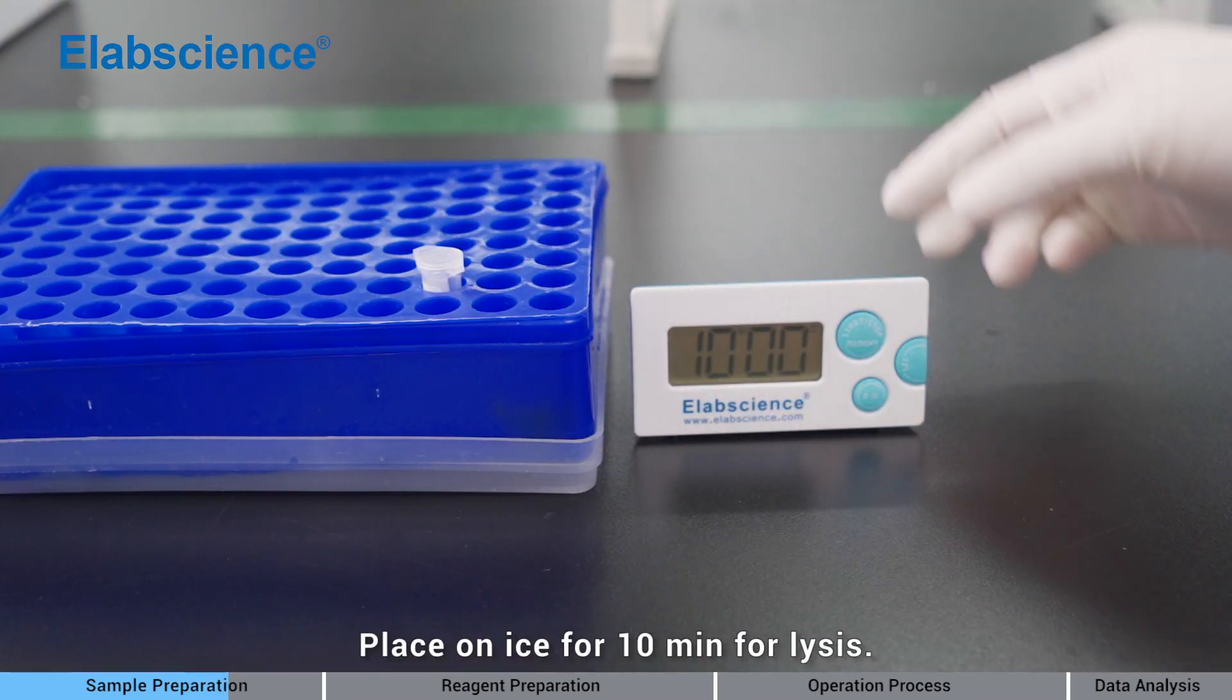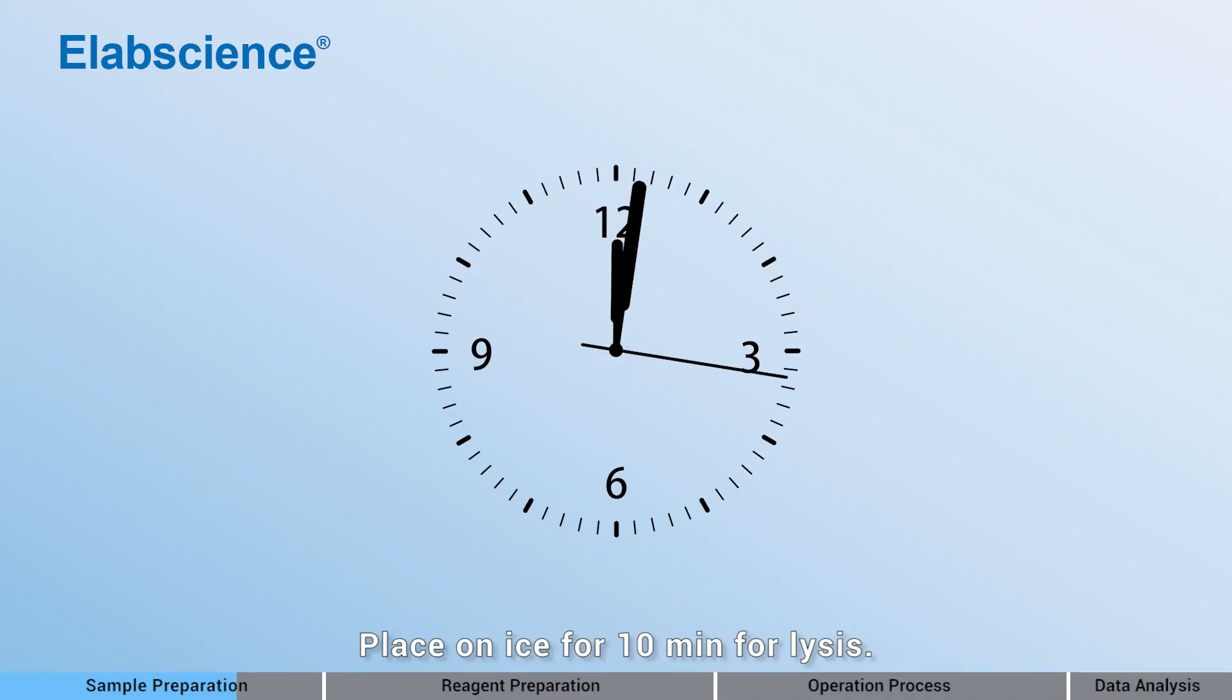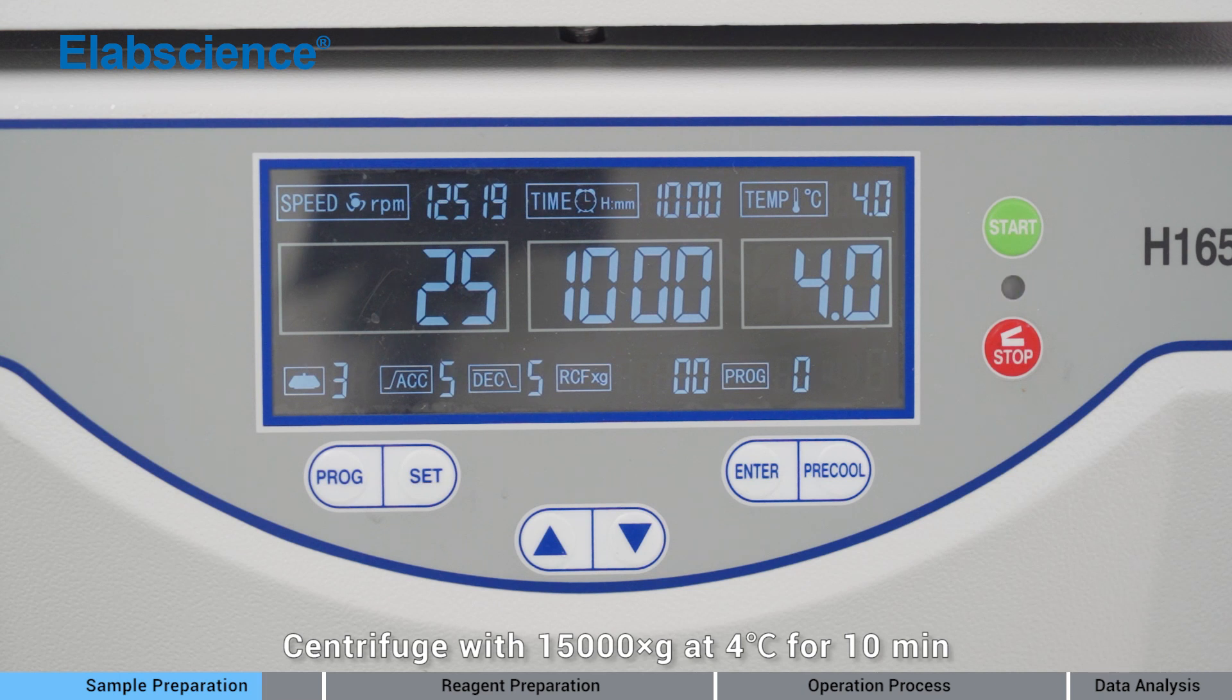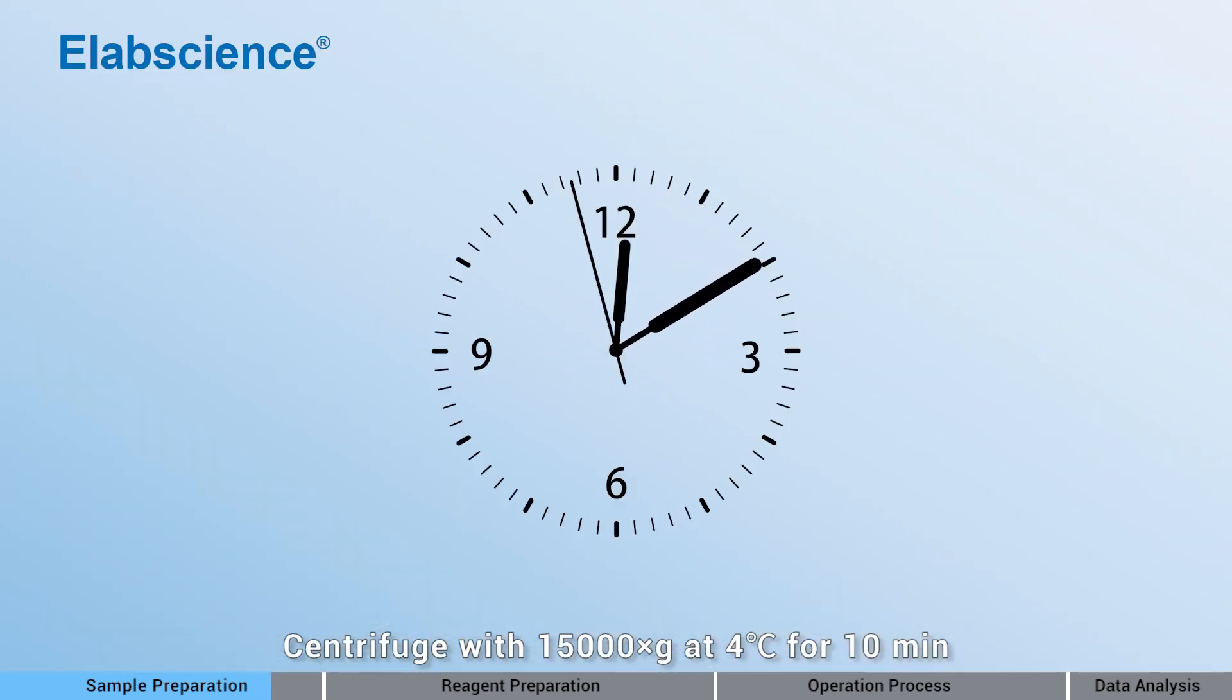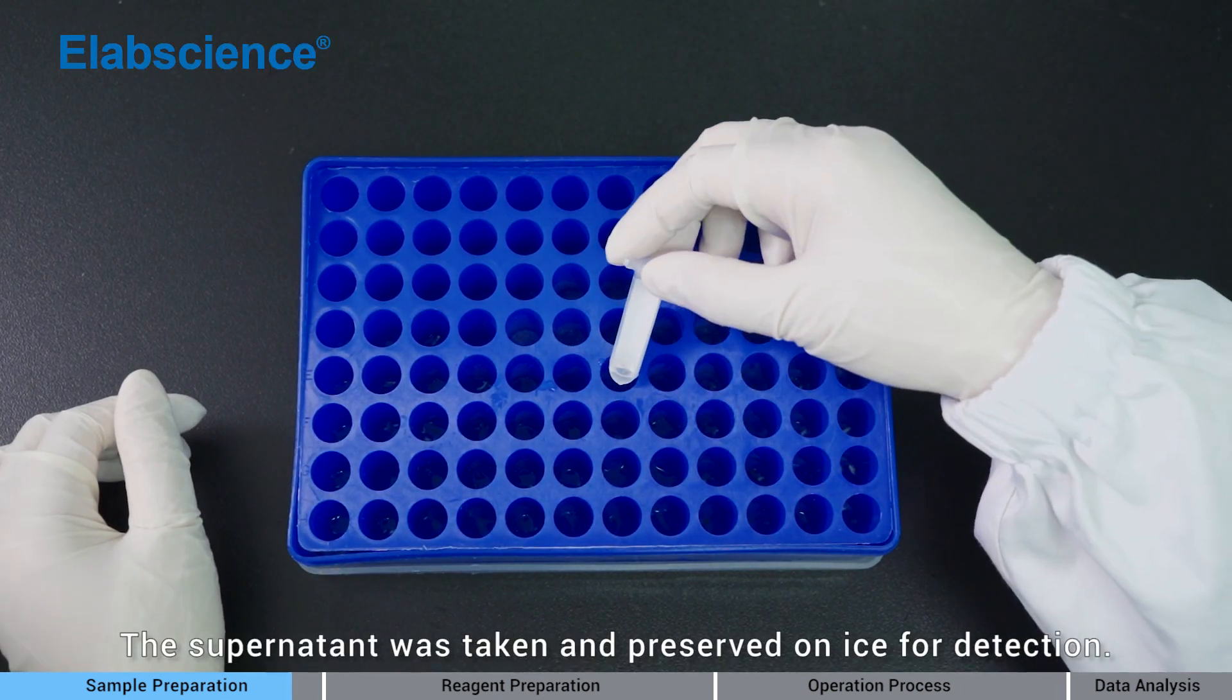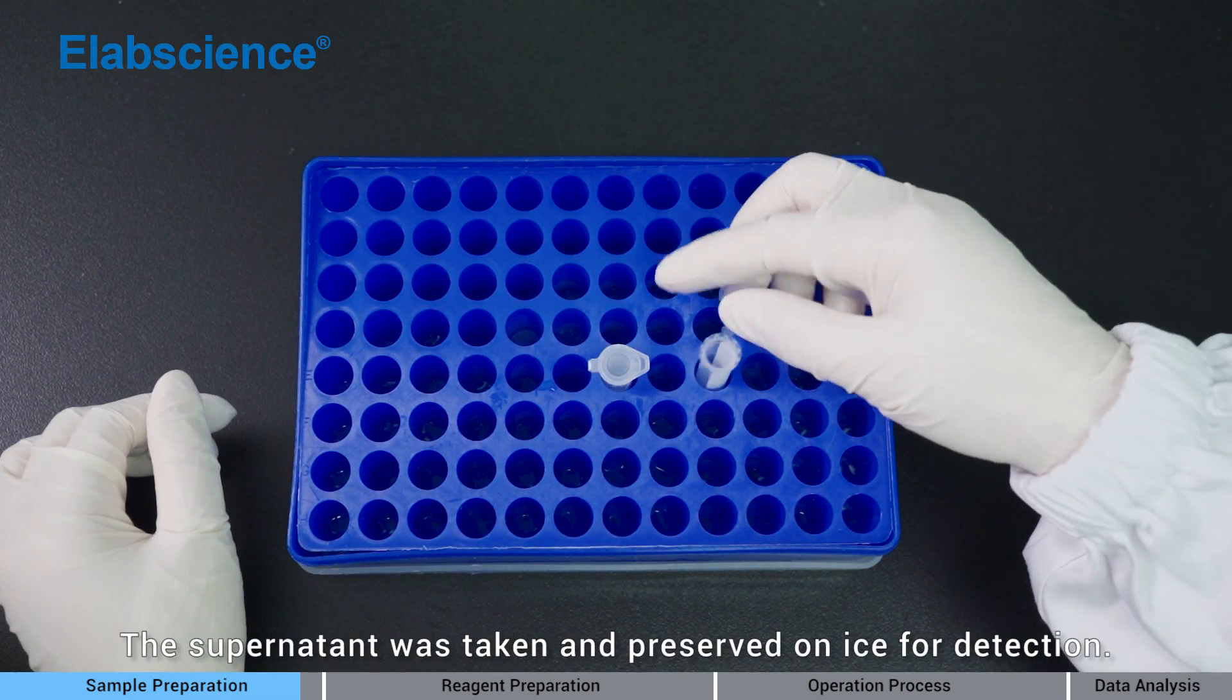Place on ice for 10 minutes for lysis. Centrifuge with 15,000 times gravity at 4 degrees for 10 minutes. The supernatant was taken and preserved on ice for detection.